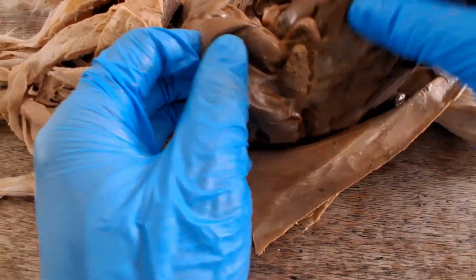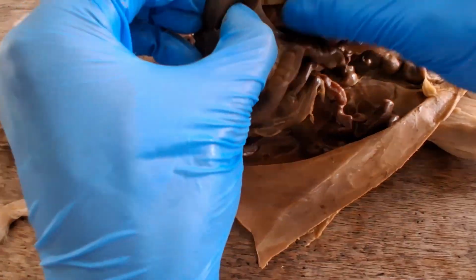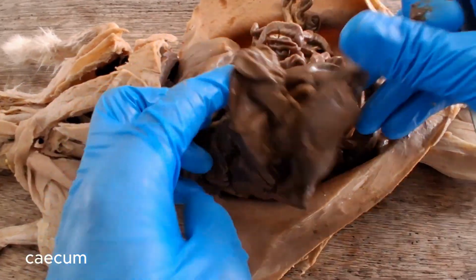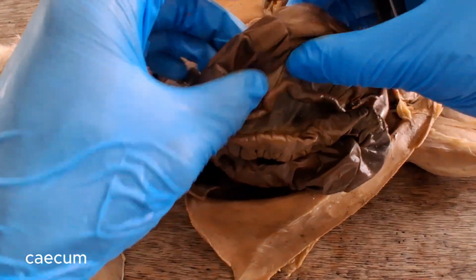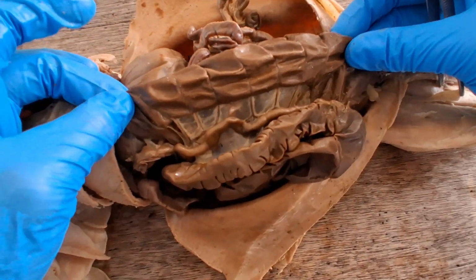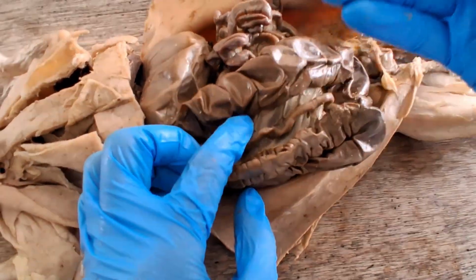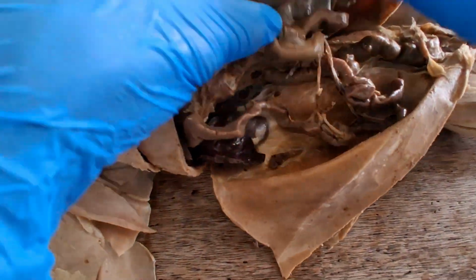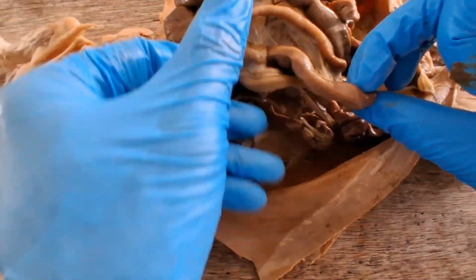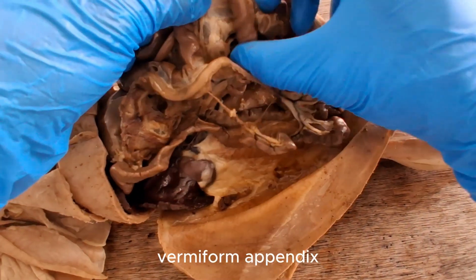But typically, the food coming from the ileum will go first to this large organ here in the rabbit, which is the cecum. This is where symbiotic microbes live and help the rabbit digest all those fibrous materials. So this is the cecum of the rabbit. It's gonna spend some time there digesting all that fiber. And if you follow the cecum more distally, it terminates into a worm-like organ here called the appendix. So this is the appendix.